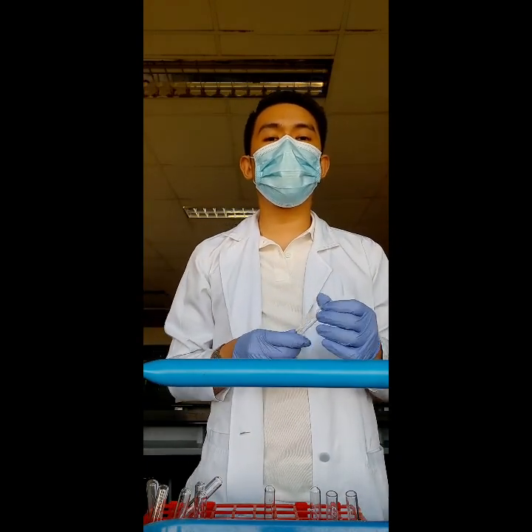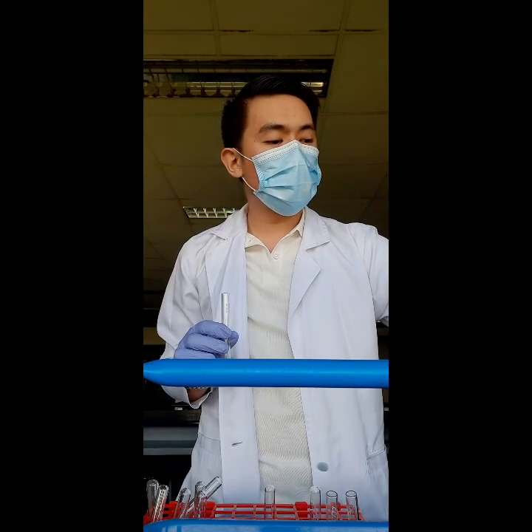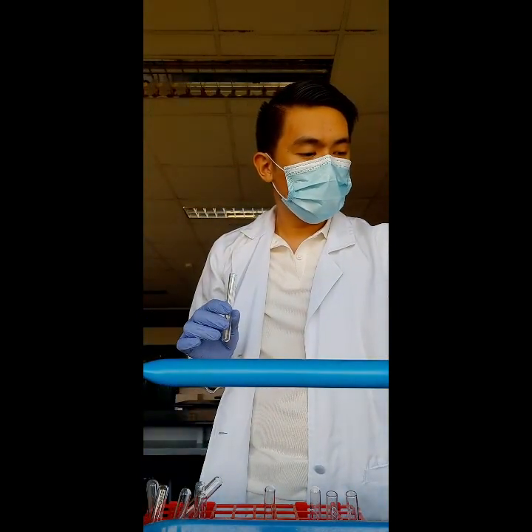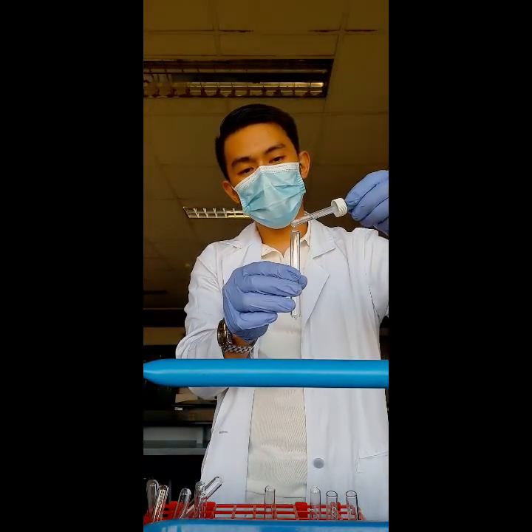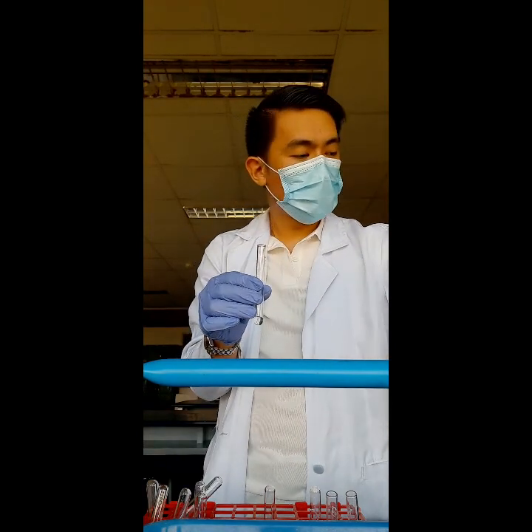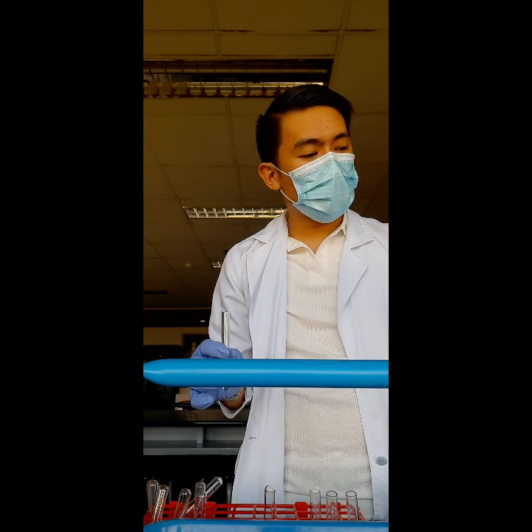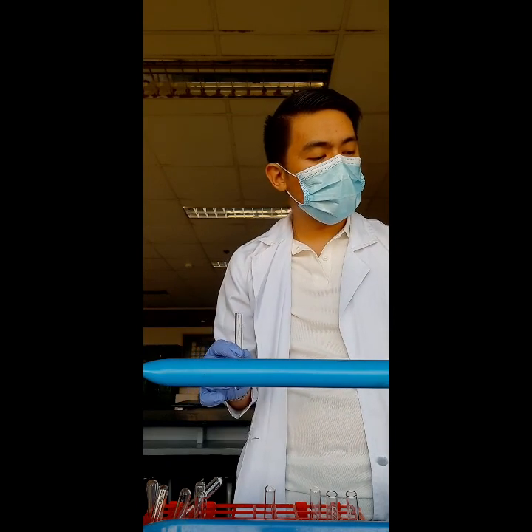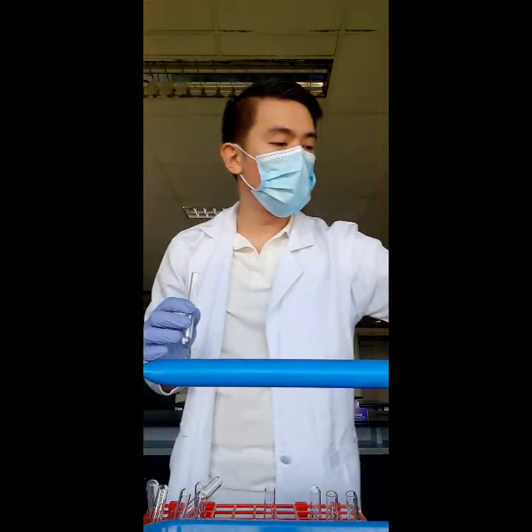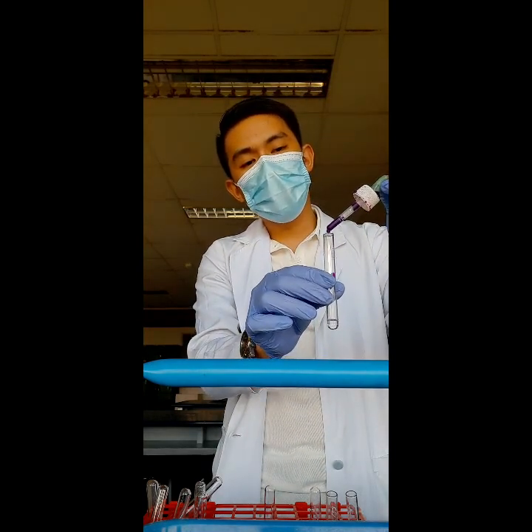This is for the last unknown for our Group 1 anions. For this one, we will be adding 10 drops of 1.5F H₂SO₄. Then we add 5 drops of 0.1F potassium permanganate. This will be the indicator for our unknown.